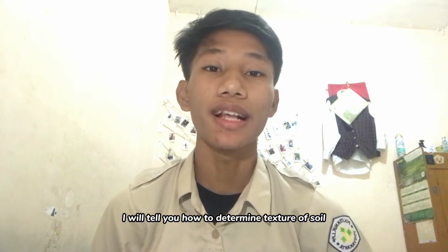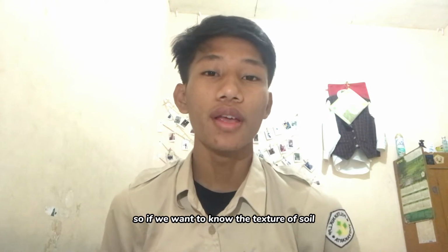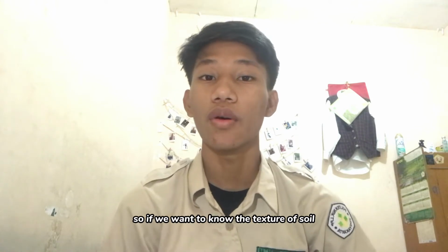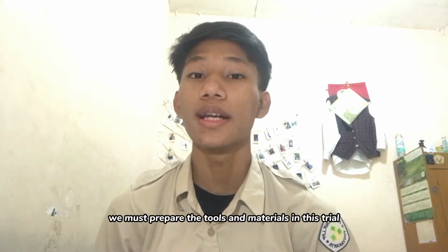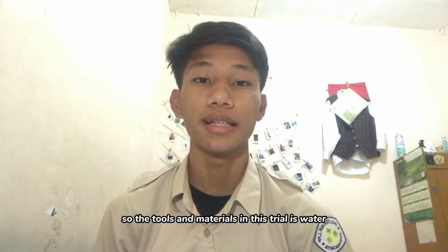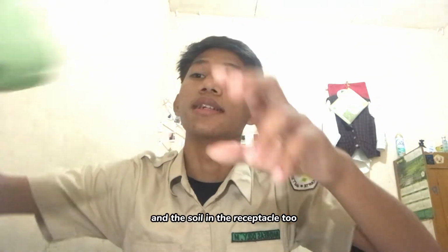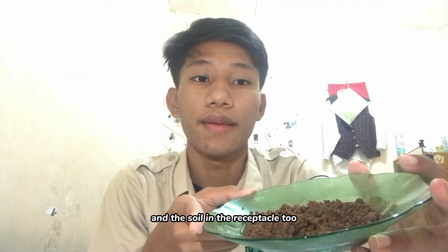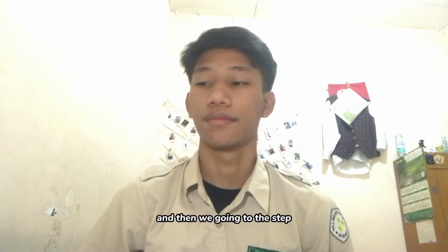In these videos, I will tell you how to determine the texture of soil with the qualitative method. So if we want to know the texture of soil, we can do these steps, and before that, we must prepare the tools and materials for this trial. The tools and materials in this trial are water that I have in the receptacle, and the soil in the receptacle too. And then we go to the steps.